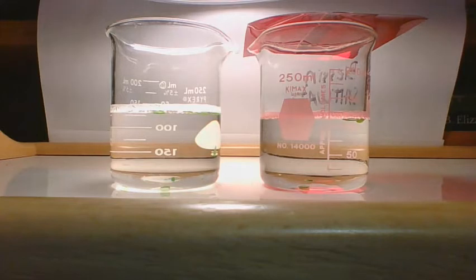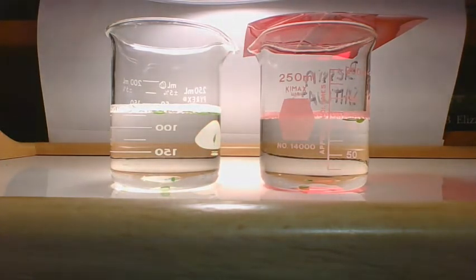So when we're doing this, we don't just stop when we get one of them completely finished. We stop when there's none at the bottom or 15 minutes, whichever happens first.